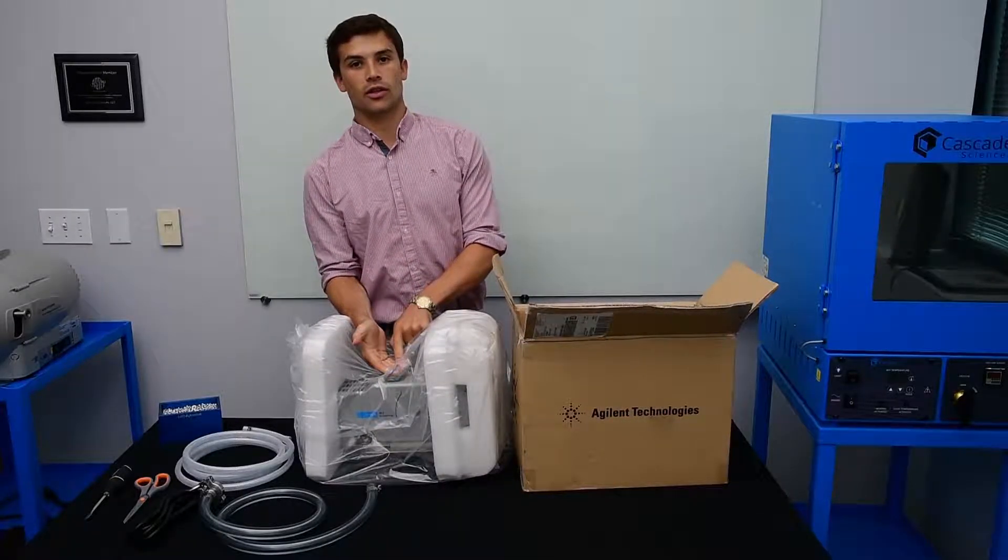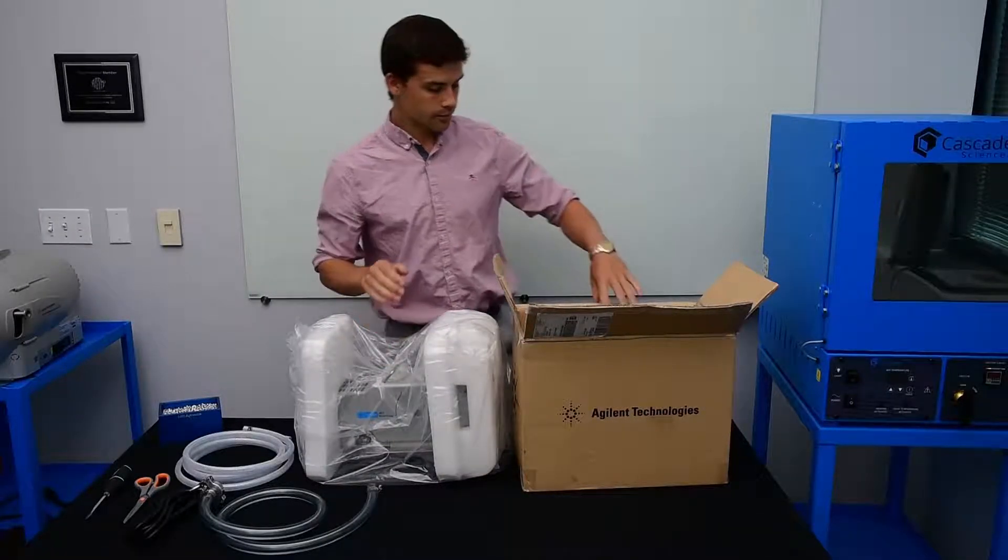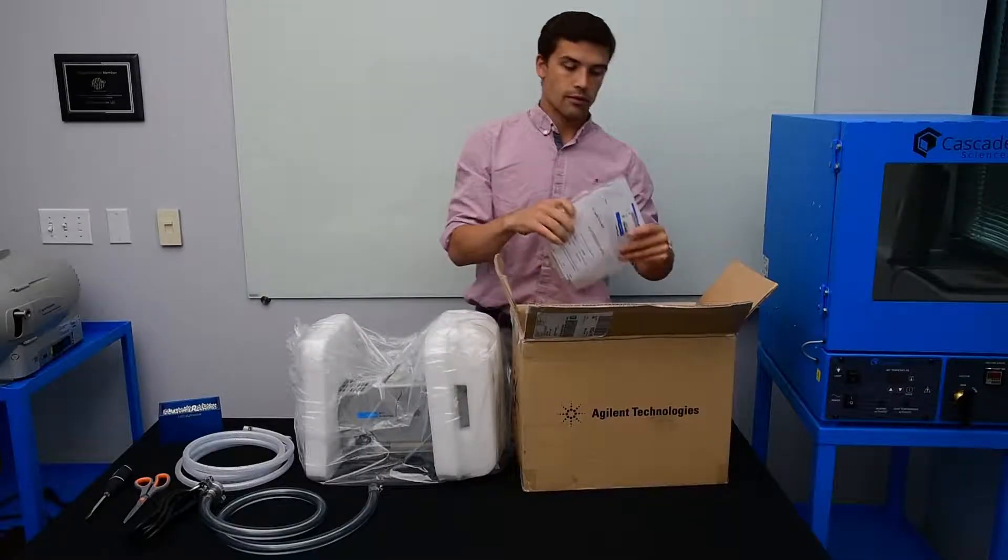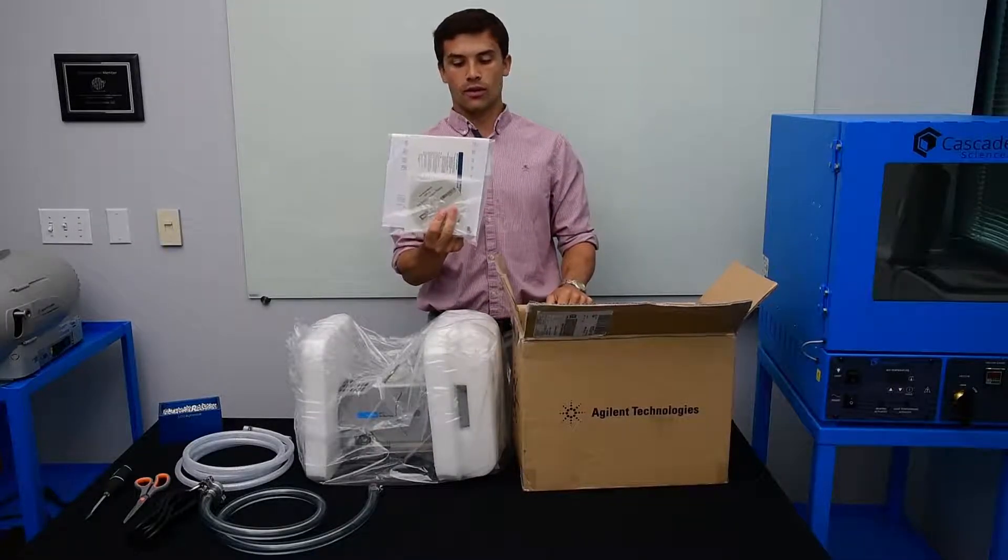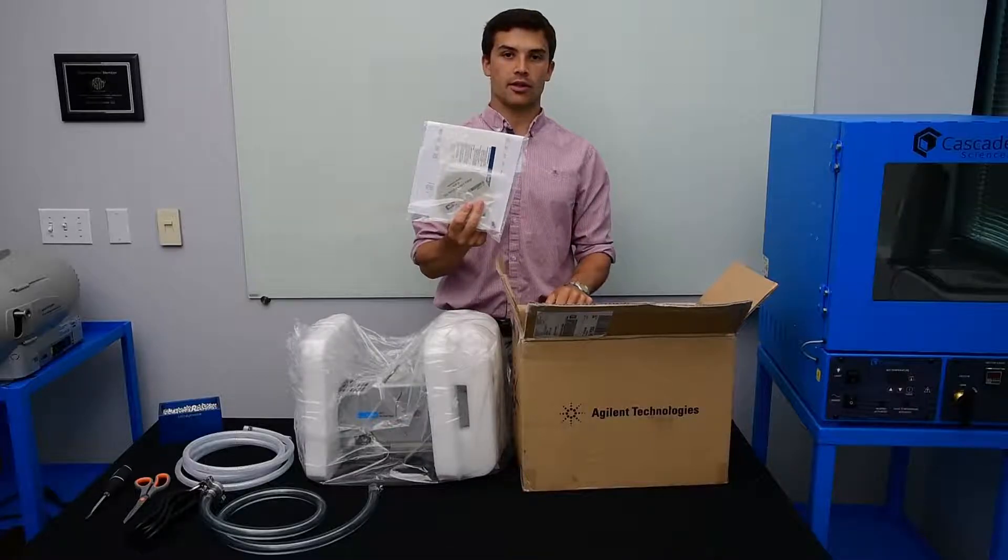There is a nice handle here that you can use to lift the pump out of the box. And don't forget the manual and quick start guide which is in the bottom of the box.